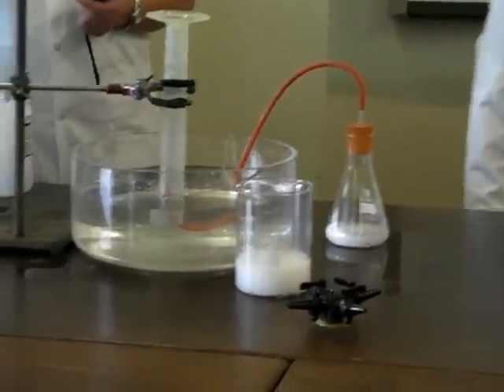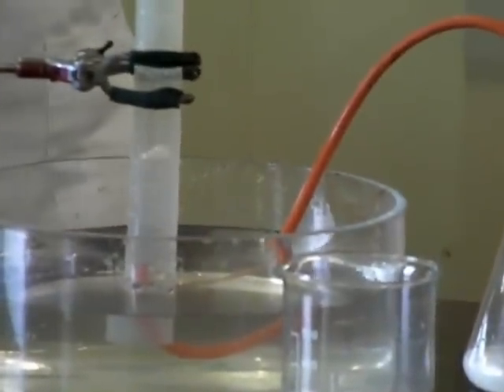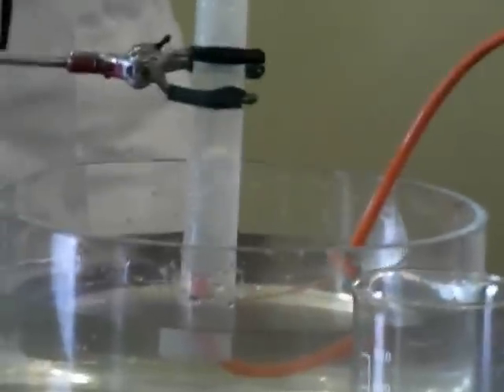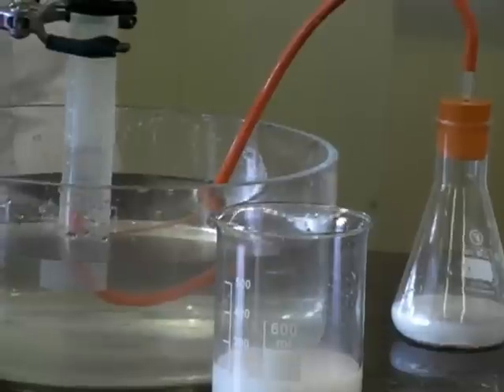So this time there's an awful lot more water particles in the way. We've got less acid particles in the same volume of total acid. That means the water particles are going to get in the way, and that's what we're hoping will change the rate.